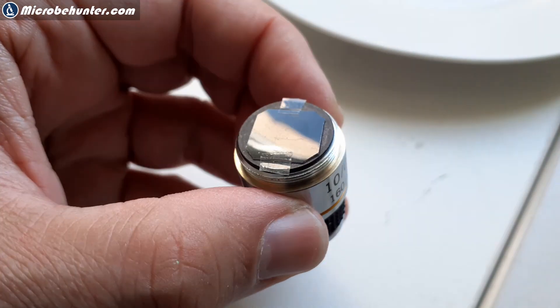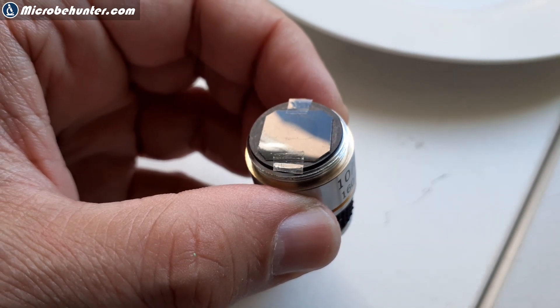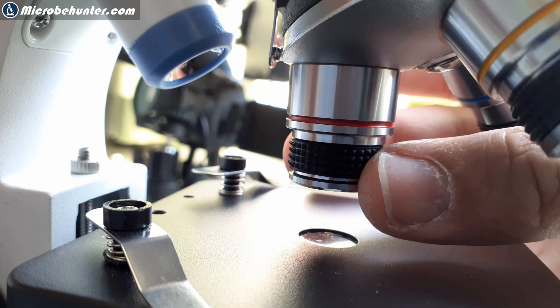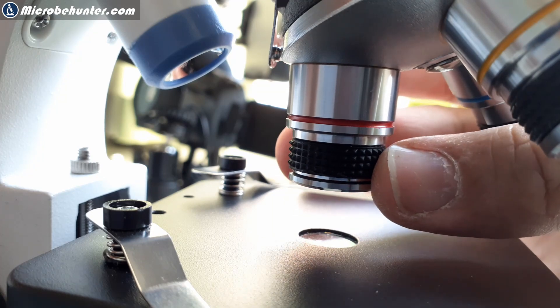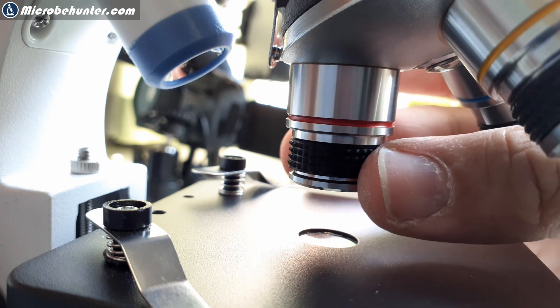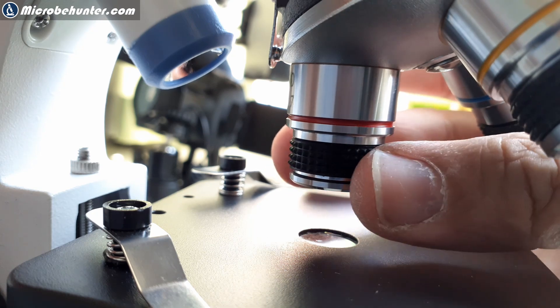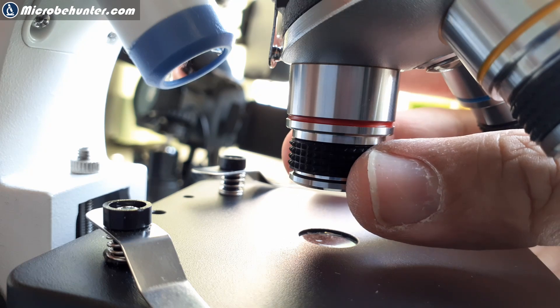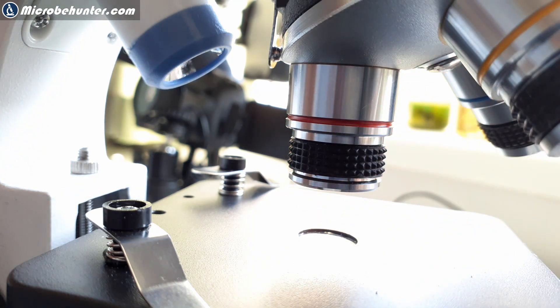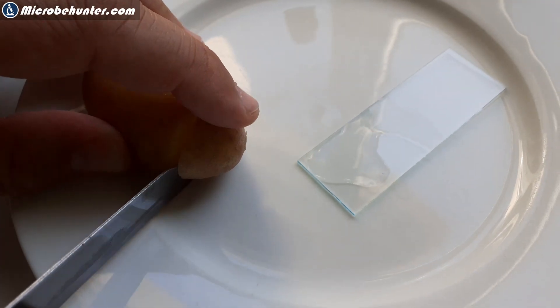I've been doing this on several of the objectives and then everything goes back in. By carefully rotating the objective you can adjust it in such a way that it completely becomes dark. Of course the objective wobbles a little bit, you have to be careful, and you're also losing a little bit of focus but you can adjust for that by refocusing.